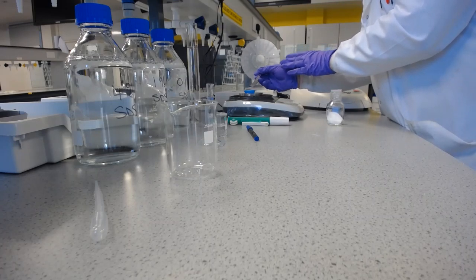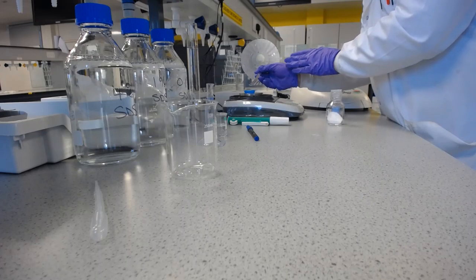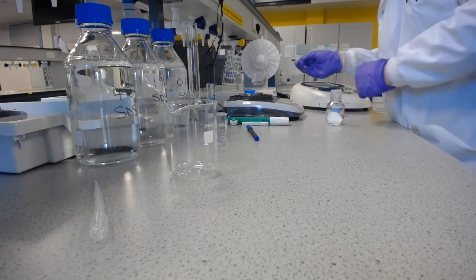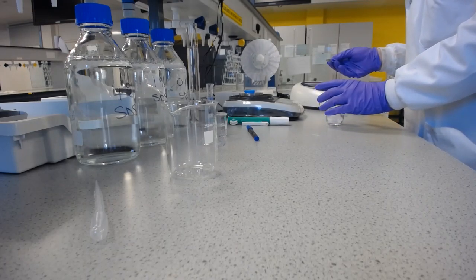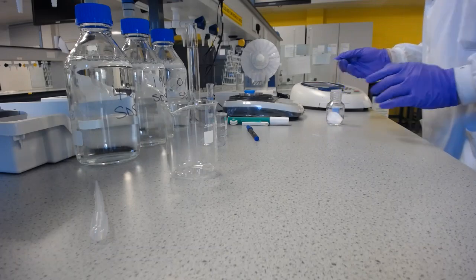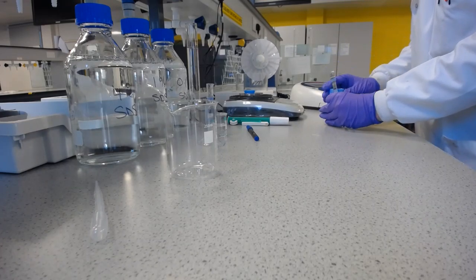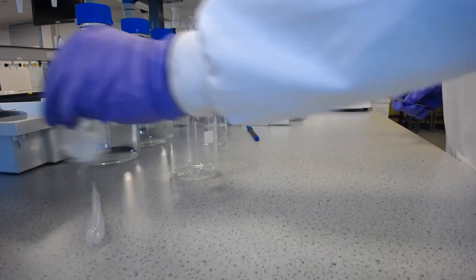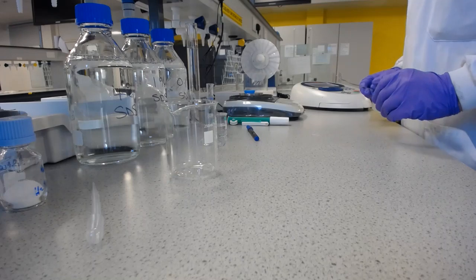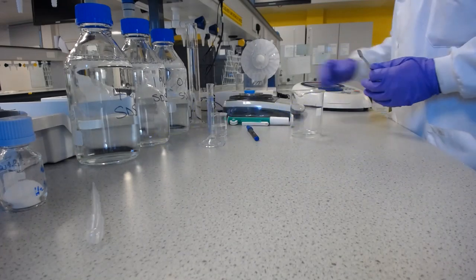Now, this is a very small amount that we need to put on. So you'll see that I'm literally just tapping it out onto the balance. And I've got very lucky there and weighed out exactly 8 milligrams. That is very fortunate for the recording. So we'll get rid of the aspirin now, and I need to put that into 100 millilitres of water.